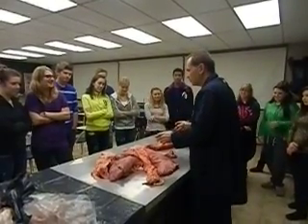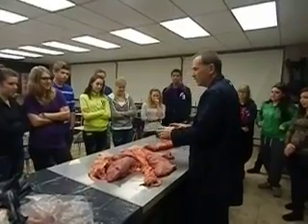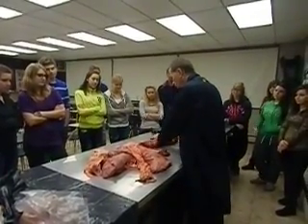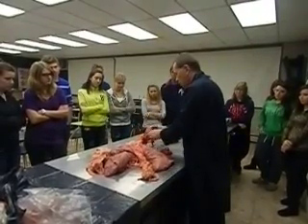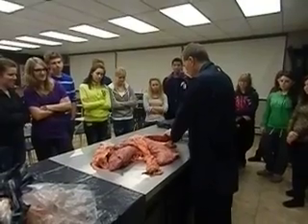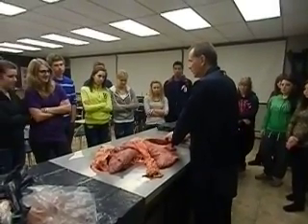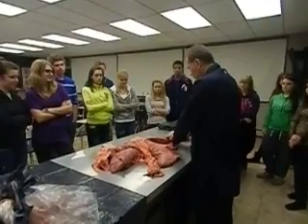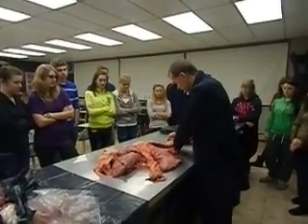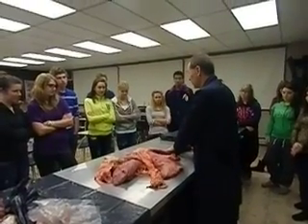Okay, first of all, I mentioned how tough the trachea was, and it doesn't matter whether it's in a cow, whether it's in a pig, or whether it's in a human. This is the trachea itself right here. Although this one's damaged right here, it's still intact over here. And I did mention, like when you're playing hockey, if someone took a hockey stick or a puck into the neck, could this actually collapse? You'll actually see when I hit it. Like, that is pretty tough.